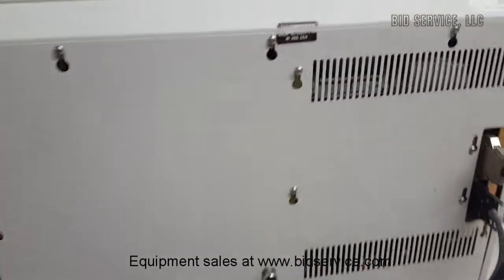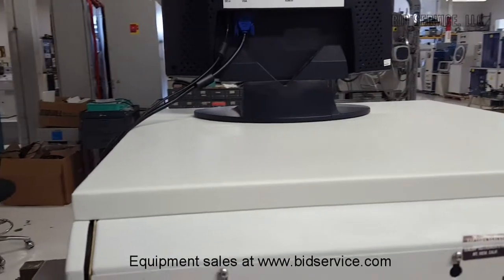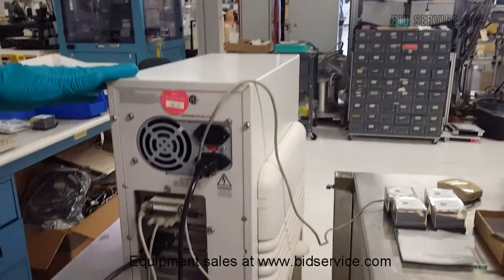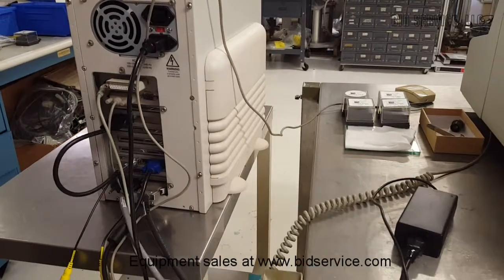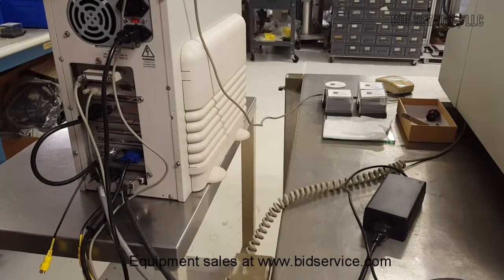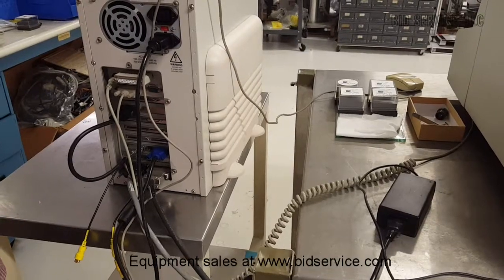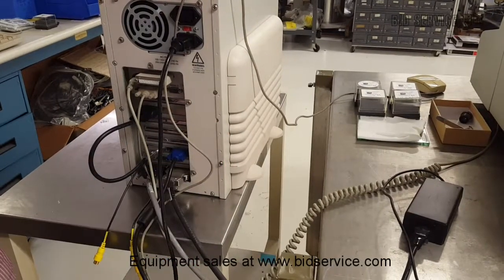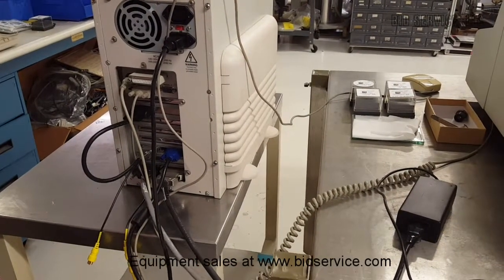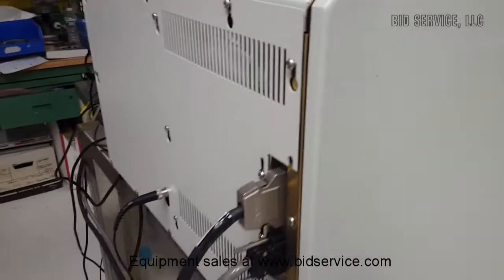Now the monitor can be placed on top of the system if necessary, but this cooling fan in the PC could cause minute vibrations, so I have chosen to separate them. So the profiler is on one table and the PC is on the other table. But the cooling fans are not that rattling in this machine, so if the PC is kept on the same table, it might work, but it is recommended to keep it on a separate table or just to isolate the vibrations. So there's a built-in vibration isolation table on this system. It can take care of it also.